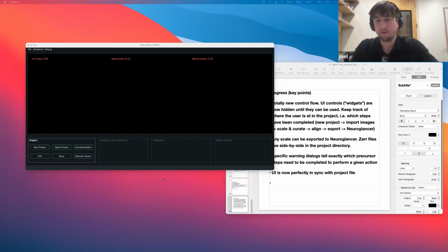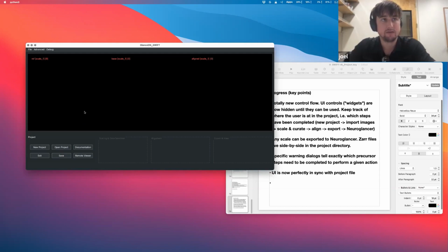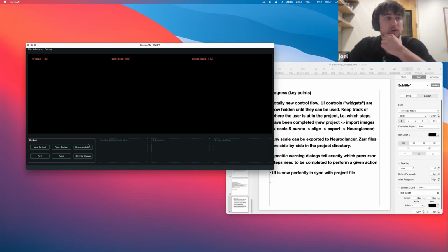By the way, I wanted to say thank you to everybody who responded to my request for feedback on the style sheet for the application. I put a few of them in here. I think this is the one that got the most votes. But this isn't functionality, and I'm really excited to show off some new functionality. I'm just going to do a little alignment project here and use a small data set, and we'll go through it.